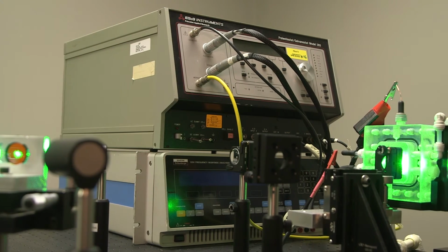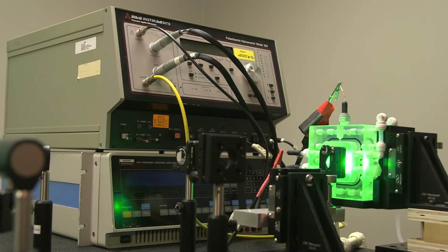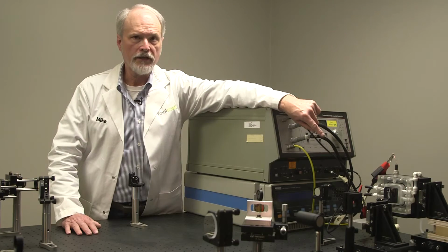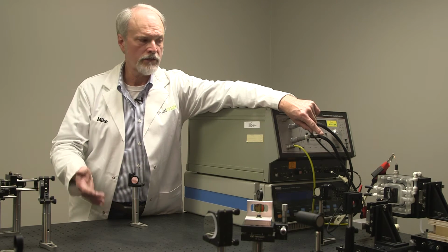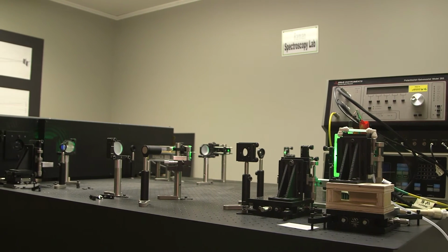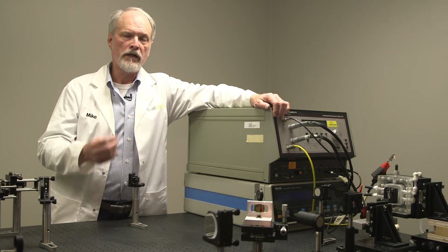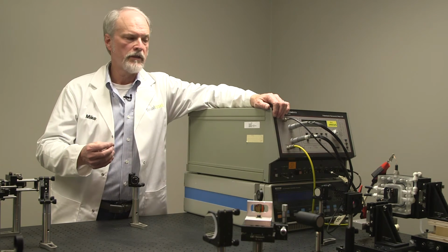At the same time, we can deliver light in through a window in the front of that acrylic block, excite the surface that we're interested in studying, say steel, galvanized steel, zinc, or whatever, aluminum, and look at the reflected light and look at the corrosion products and exactly determine the molecules that are on that surface.